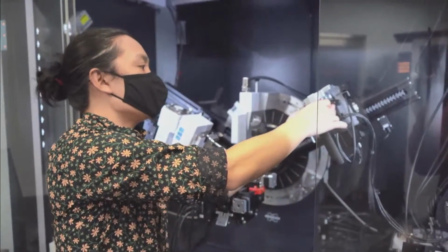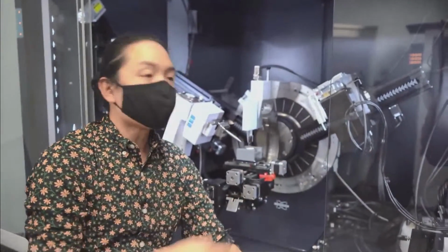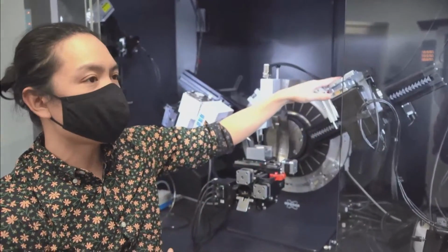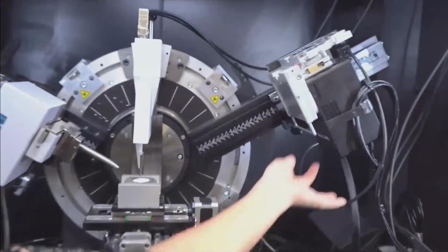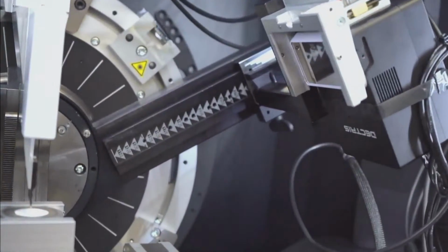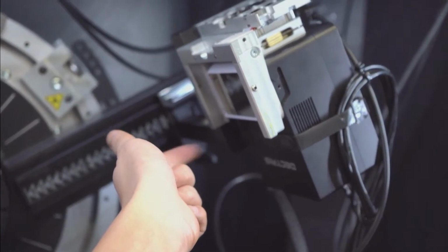Okay. And when you turned it, there's actually like a magnet that helps to pull it into the right spot, right? Yeah, exactly. And there's also all these little chips on the detector, which means the system will automatically recognize which orientation it's in. So I'll take the shield off, and you can see now that we've got a wider detector. So this is going to cover more in the gamma direction, right? Which is going to give us more of those Debye rings, more coverage of those Debye rings.